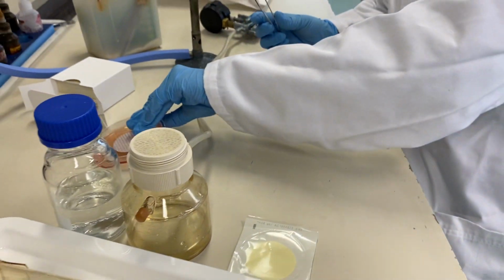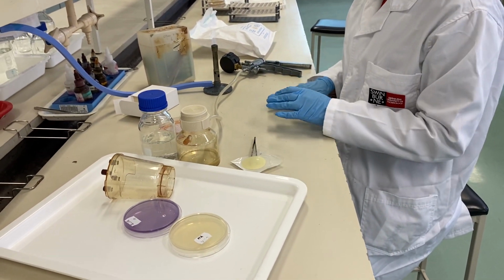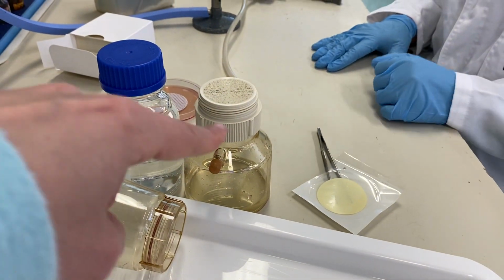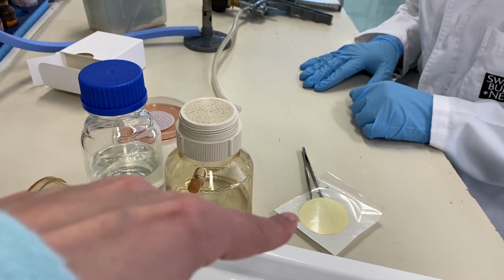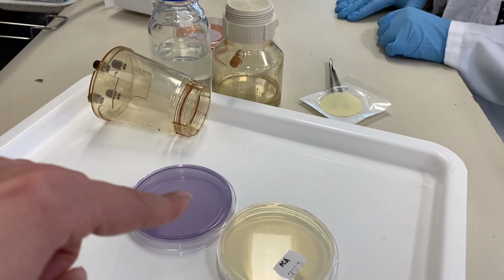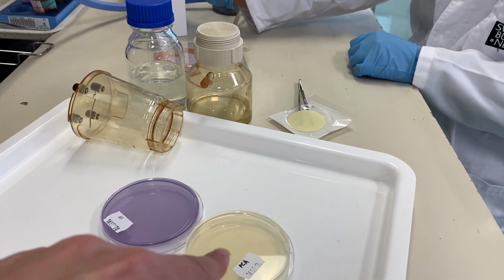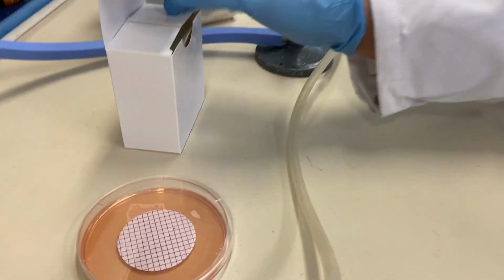So what Sanjida did was for working with the first batch of this water sample. So we are going to continue with a second batch and a third batch, and again we cover the filters in the KF and PCA. PCA stands for plate count agar. So similar to what we did here.